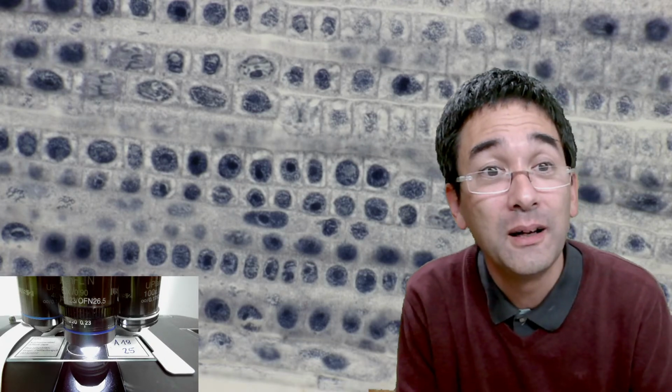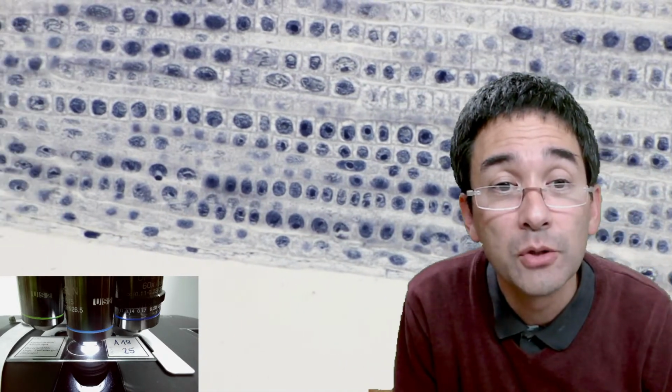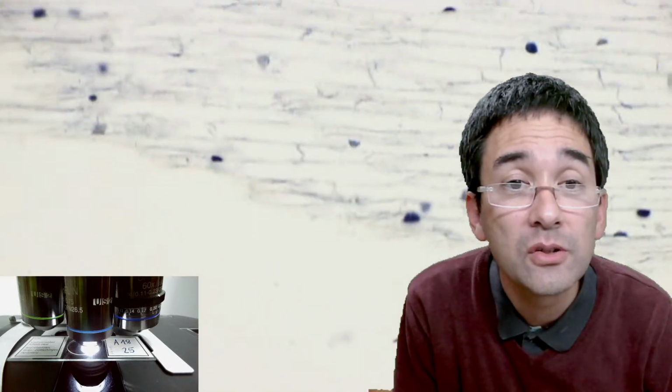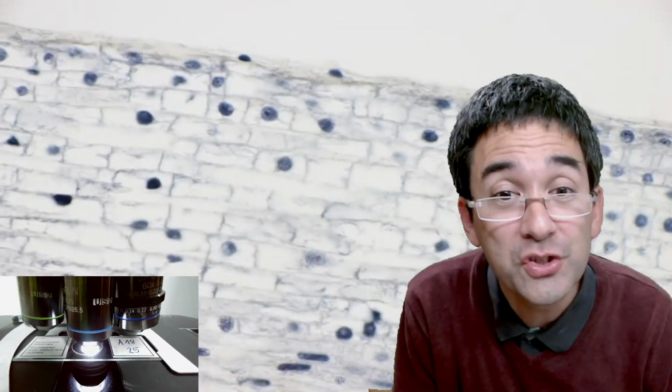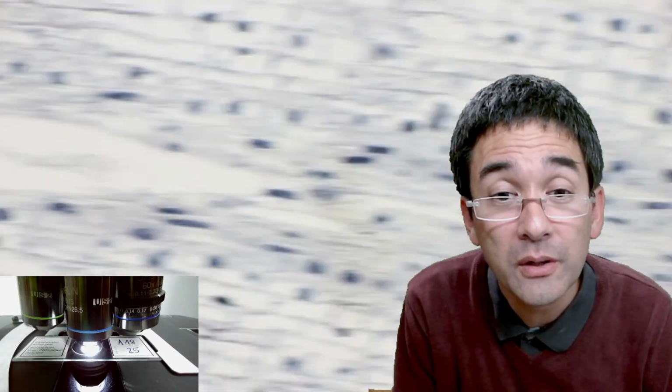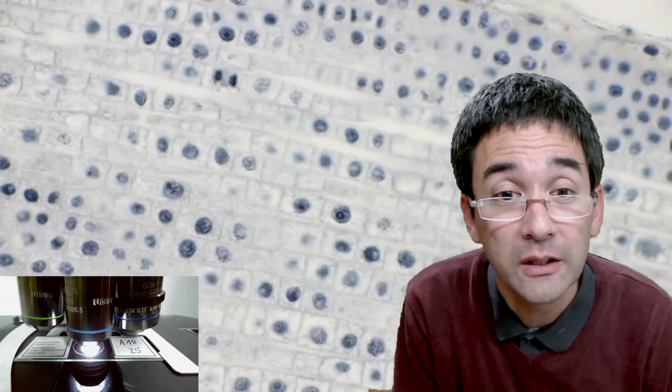Yeah. So let's continue to look around. I'm going down with the magnification again to 40 times because I get a better overview this way. And what time is it now? It's 39. I want to show you a second slide as well, where you can see it much better. Let's go up here. Maybe let's try this one over here. Maybe I find a few more. You've probably already noticed that there are not so many cells where you can see the chromosomes. It was only a handful that I was able to show you.